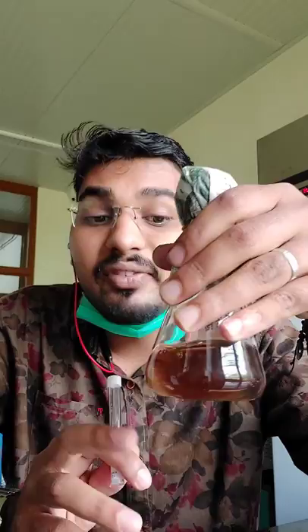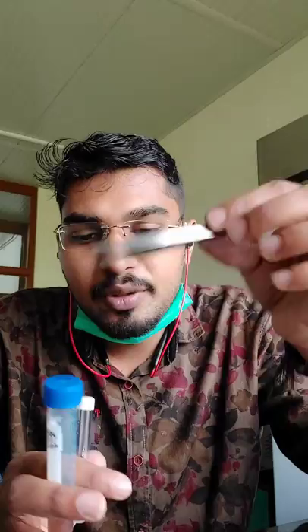For this experiment you need sterile discs, and also an inoculum. I am doing antifungal activity using Aspergillus spores - this is a spore inoculum. You also need the plant extract whose antimicrobial activity you want to test, sterile pipettes and tips, forceps to handle the discs, a sterile petri plate to hold the disc while you add the extract, and your solidified potato dextrose agar media for fungal work.